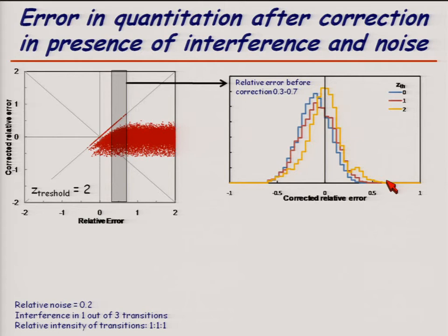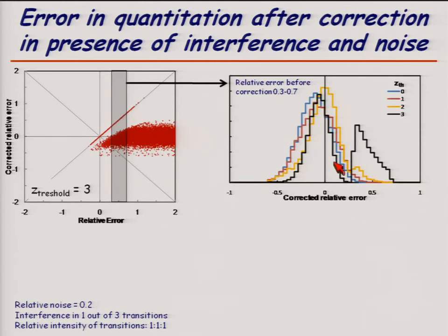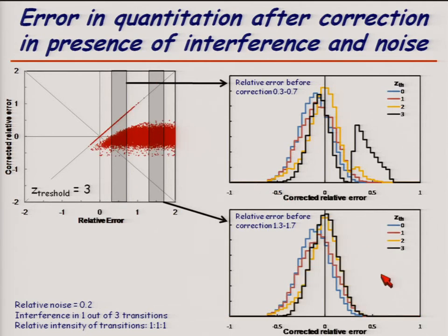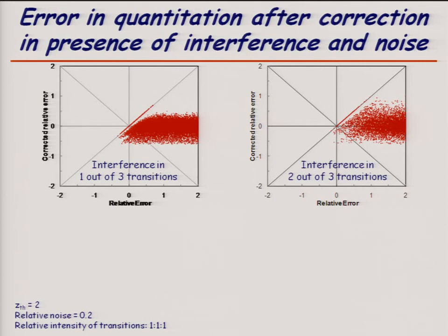But now when we raise it up to 2, we see that we start getting some interference left over. You can see that those are these dots left on the diagonal. And if we go to a threshold of 3, we start getting quite a lot that's not corrected for. If we move further out to higher interferences, we see that again the curve moves in, but out here we don't have any interference. So pretty much what this means is that if we have a large interference that's much bigger than noise, we can very easily detect it. That's the principle.